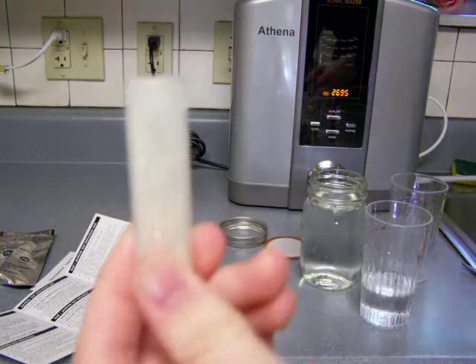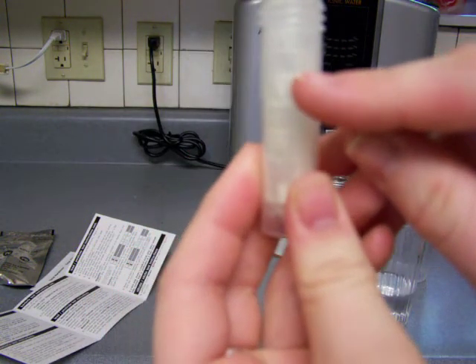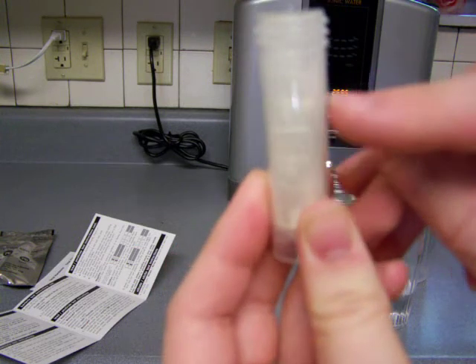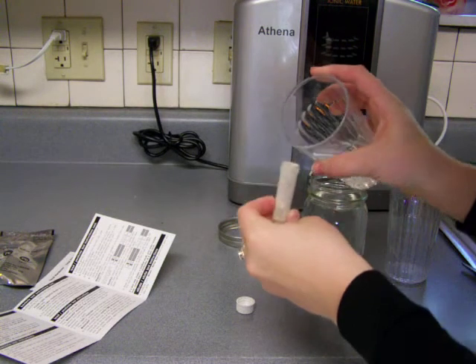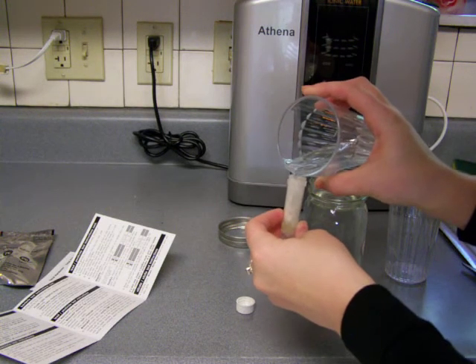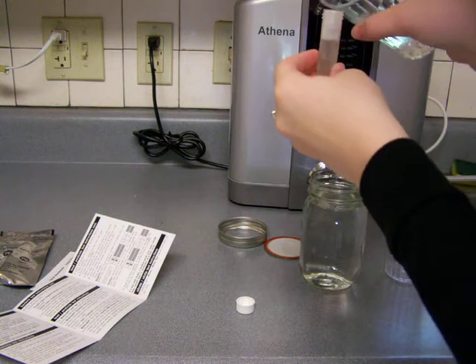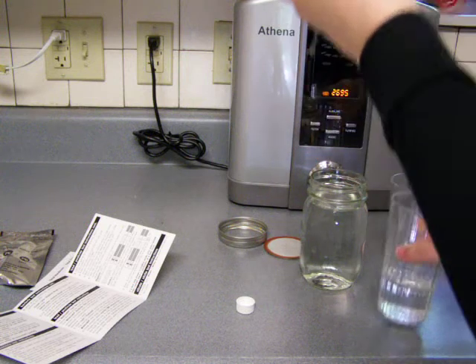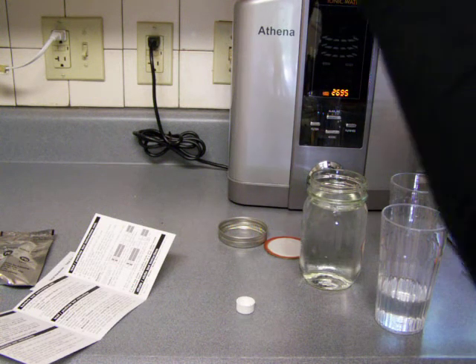Okay, so I don't know if you guys can see, the 5 milliliter line is right here. The line is actually right there where my nail is, so I'm going to try and pour this in here. A little bit more. Okay, that might be a little bit above the 5 milliliter line.